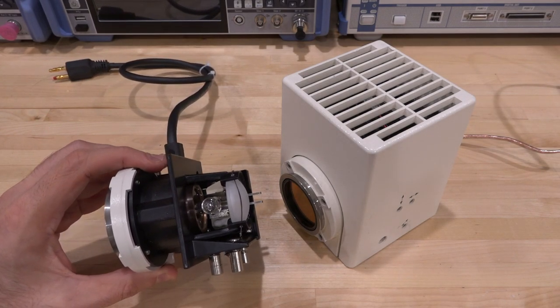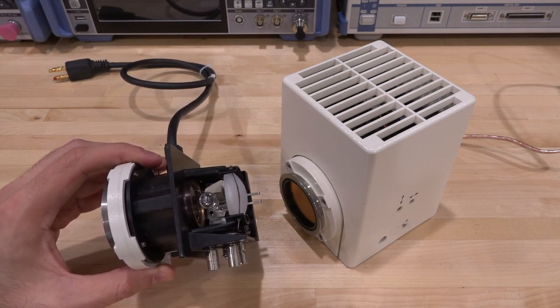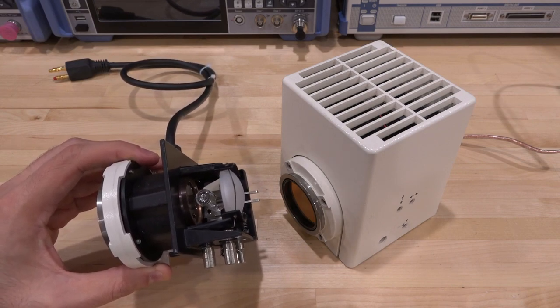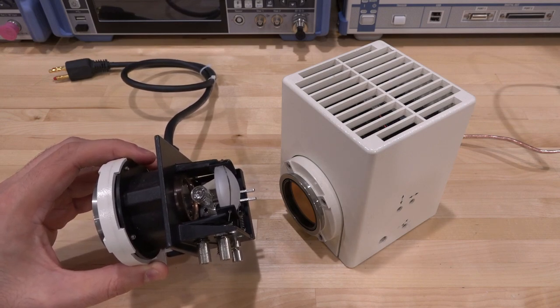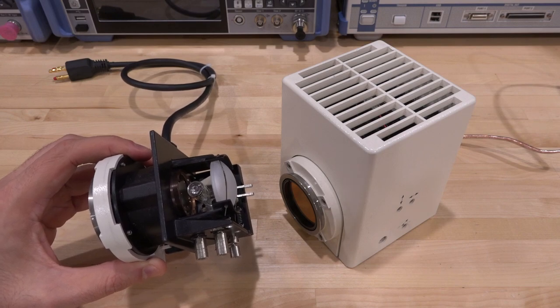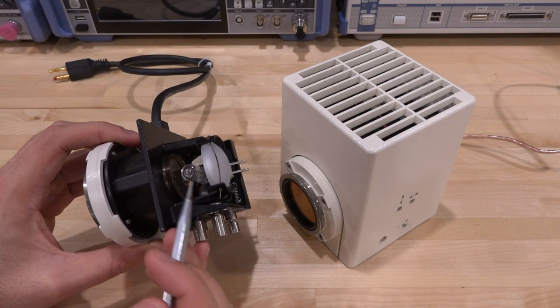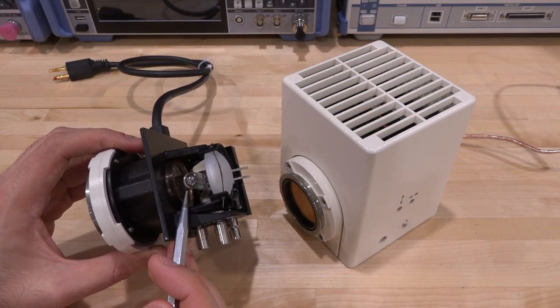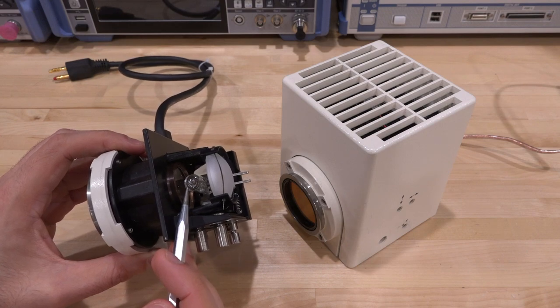But the halogen lamps have one major disadvantage, and that's the color temperature coming out of them is a function of how much energy you put into them. And that's where the term, how many degrees Kelvin there are in a light, actually comes from. It refers to what would be the spectral emission of a tungsten filament at that temperature. So if I heat this up to 6,000 degrees Kelvin, then it will be a very white looking light. But if I dim it to 2000 degrees, then it's going to be very yellow.